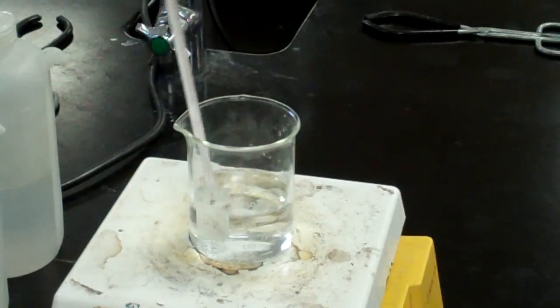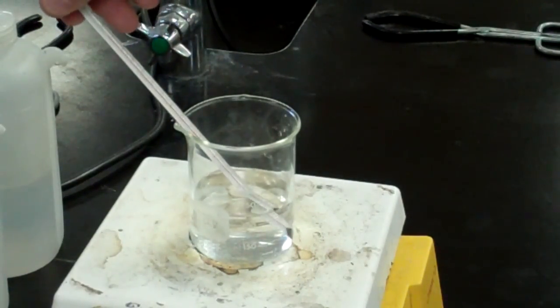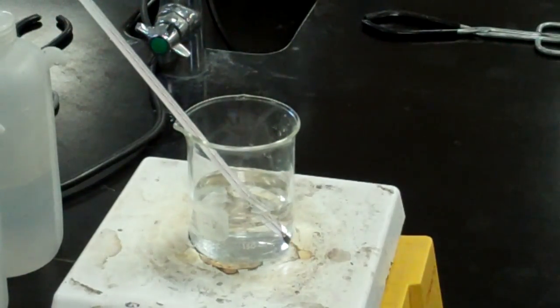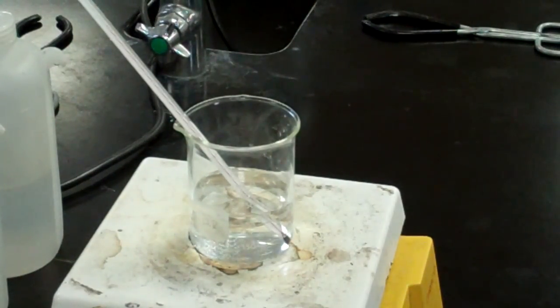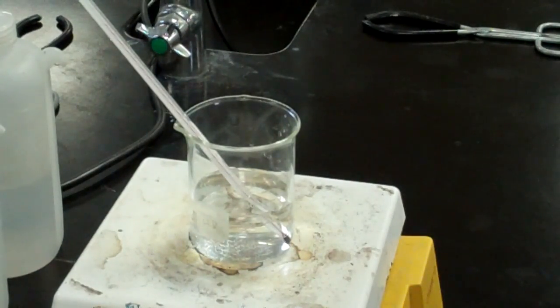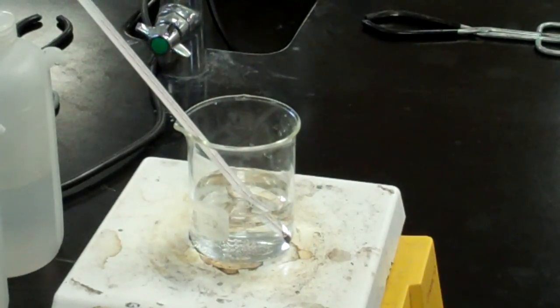Alrighty, that's about it. We're not going to finish this up. We could wait for that to boil. Right now it's at about 75 degrees. But I'll let you experiment on your own and see exactly where that boiling point ends up. Once again, you won't all have the same boiling point for your solutions and solvent because the thermometers aren't the best. But your delta T's should be pretty similar to each other if you use around 11.6 grams of solute.